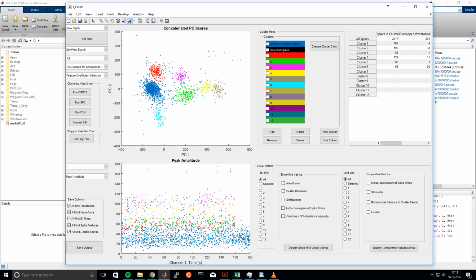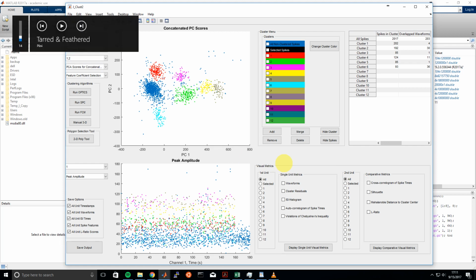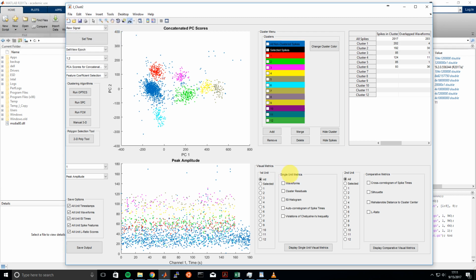Okay, so in this J_Clust2 tutorial video, I'll go over using visual metrics here to assess your unit quality and to be able to use these metrics to potentially remove false positives from your clusters and also do things like merge your clusters or delete a cluster that might not actually be a well-defined unit.